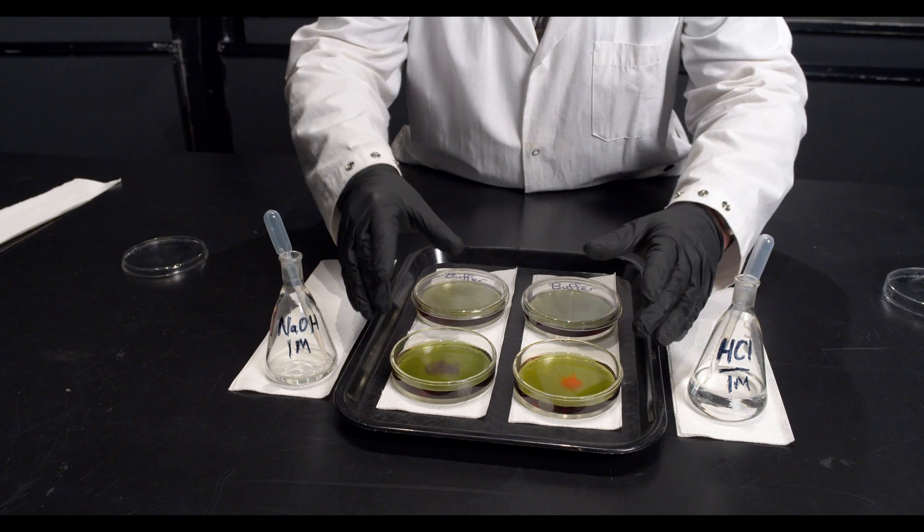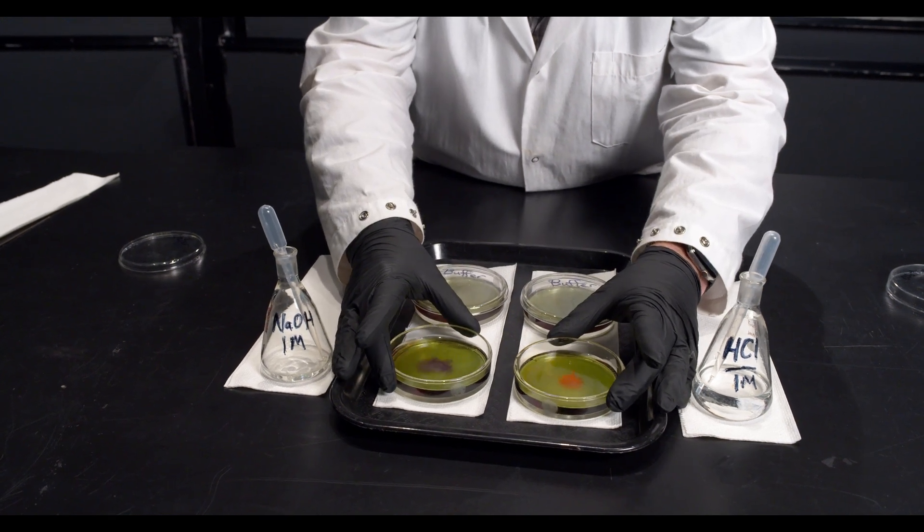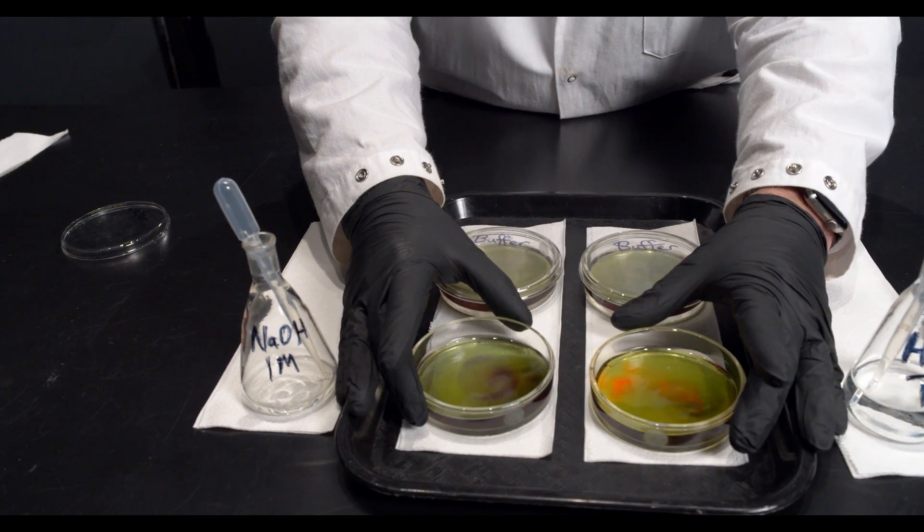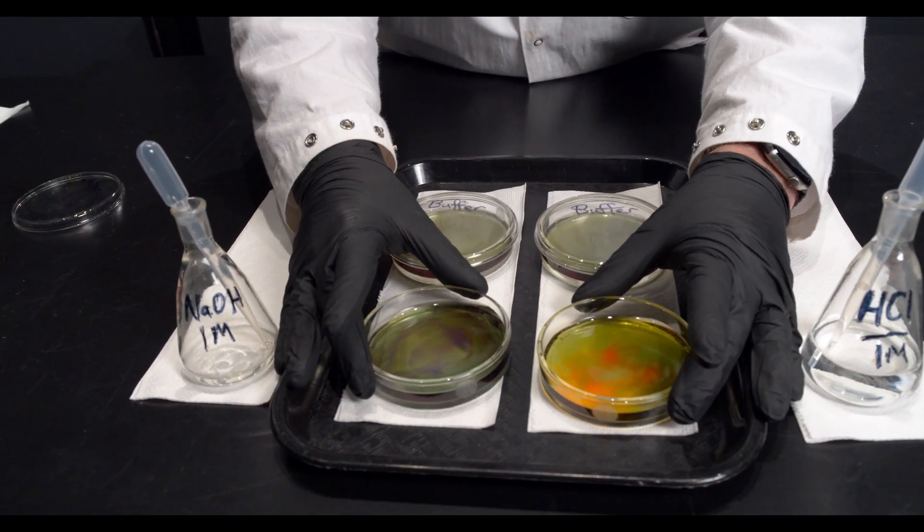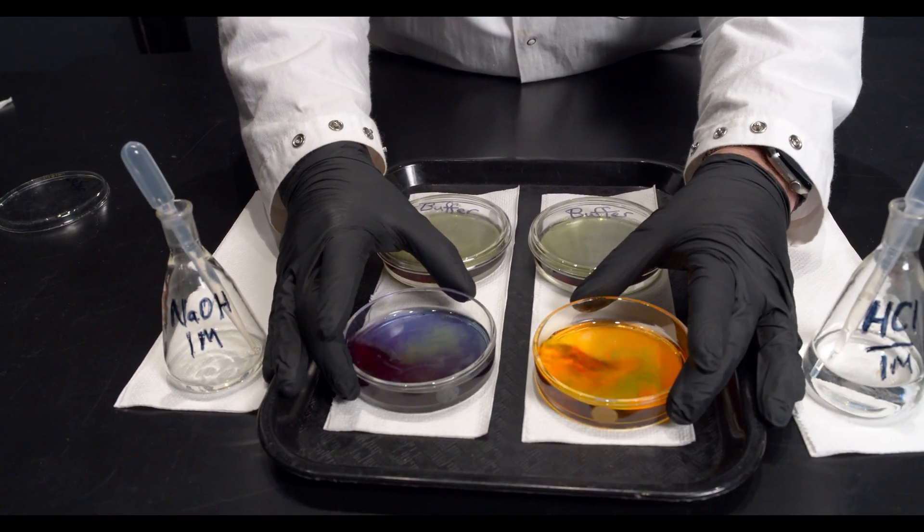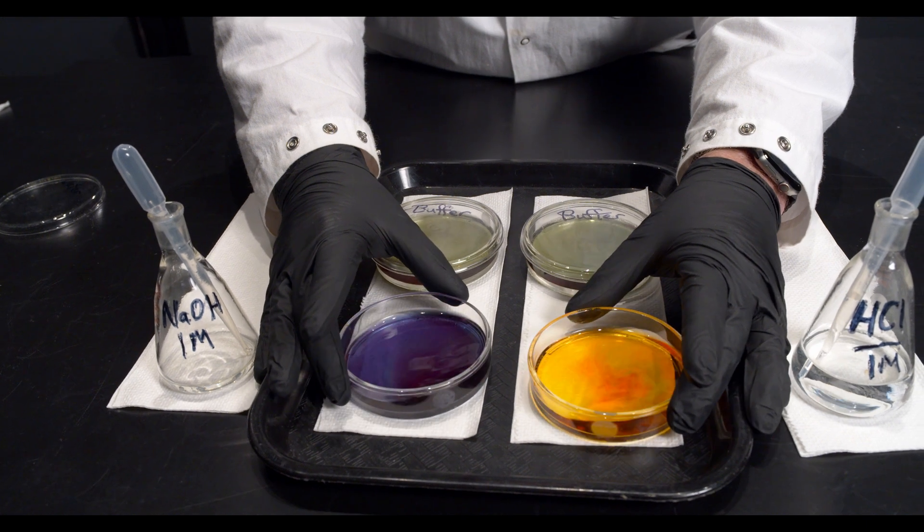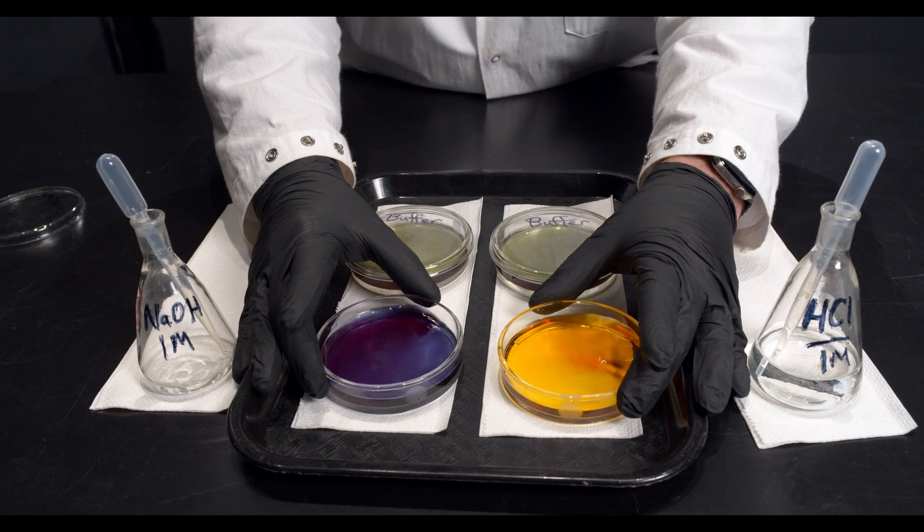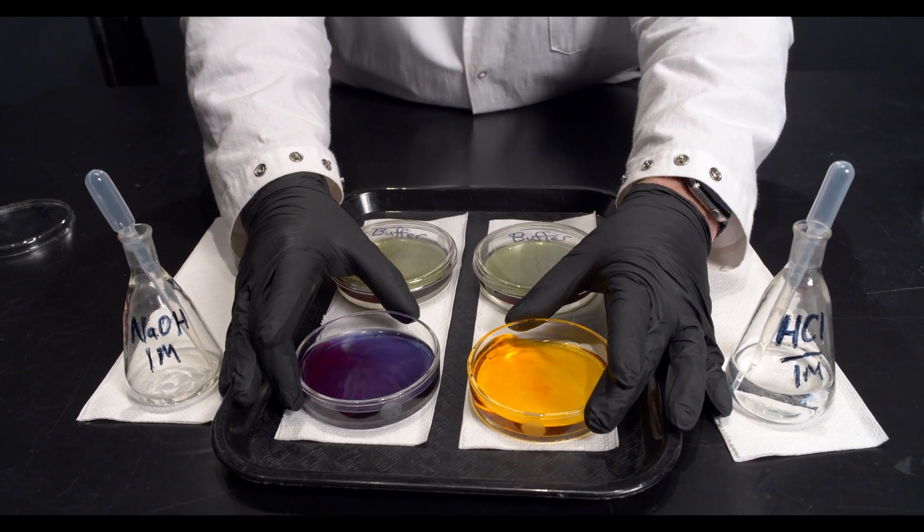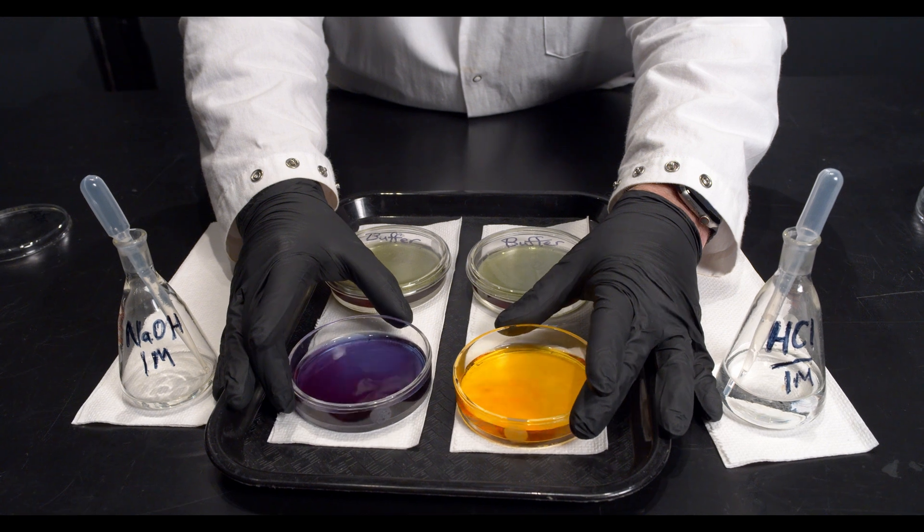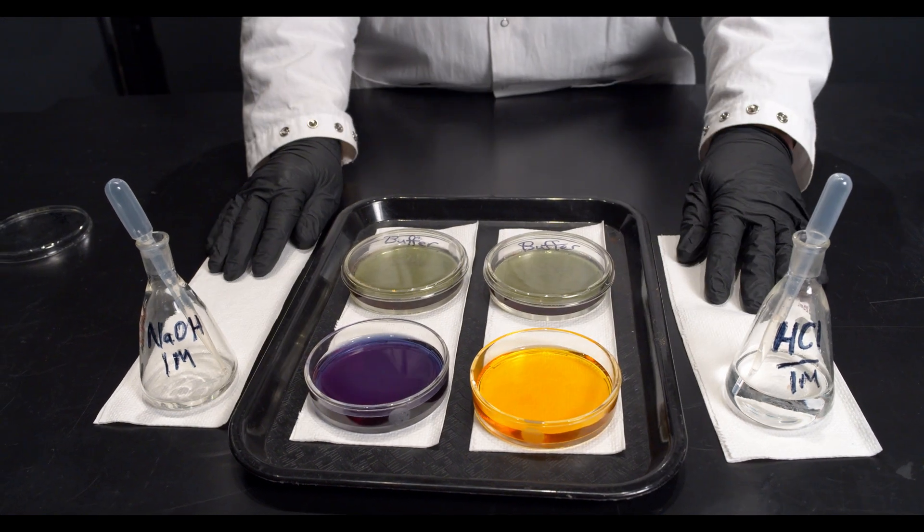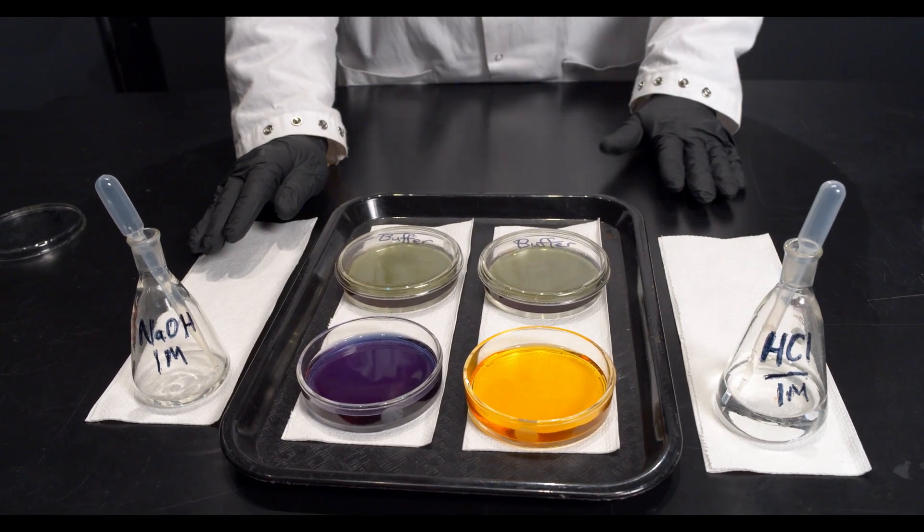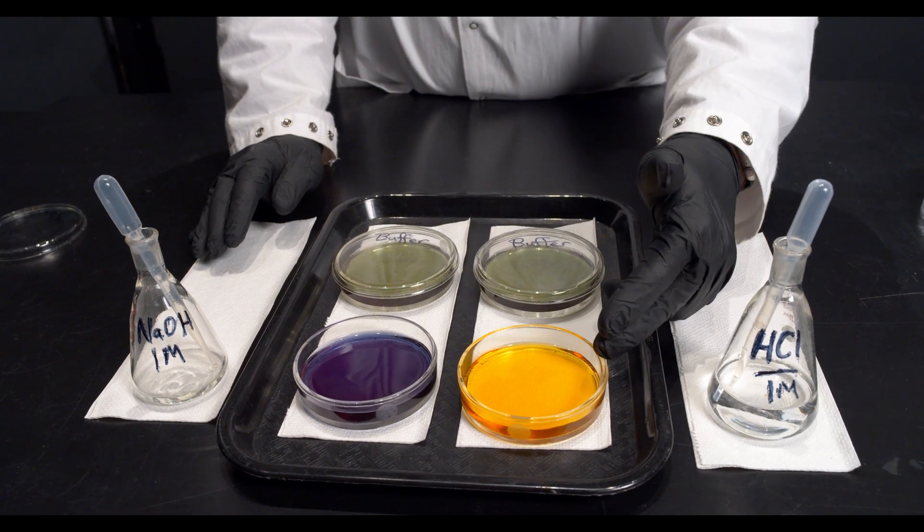So you can see where they dropped, there's a color change, but I'm going to mix them up by swirling and you can see that that one drop of acid, one drop of base has changed the pH of those water solutions significantly from 7 to around 3, from 7 to around 11.